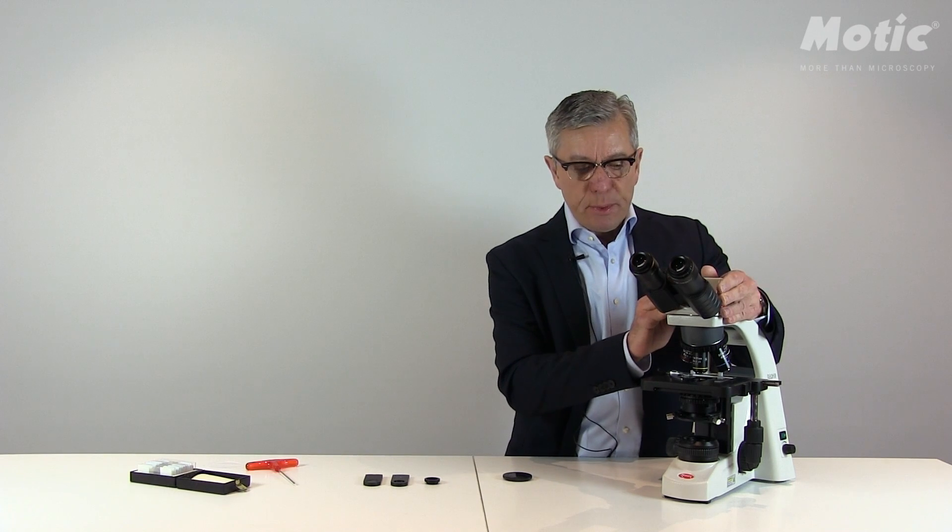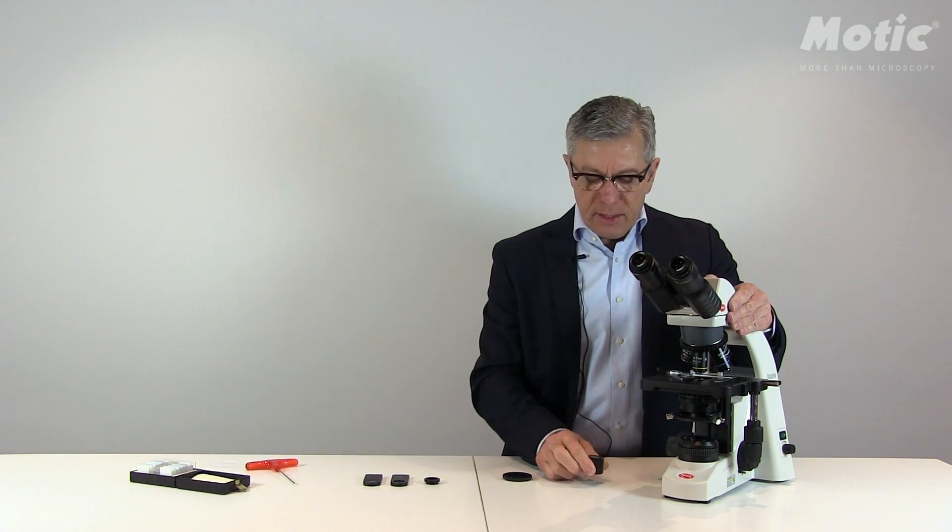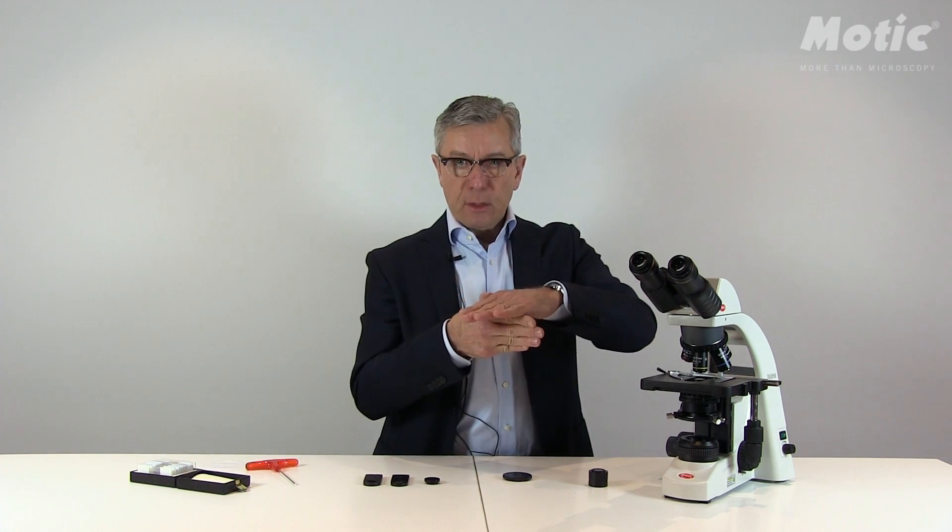The second piece of hardware we need is the so-called analyzer, which will be placed between the eyepiece tube and the upper part of the microscope. The analyzer is generally in an orientation of 90 degrees to the polarizer, meaning in a perfect alignment condition we have a dark background, and any birefringent structure will be displayed as a bright or even colorful phenomenon on this dark background.